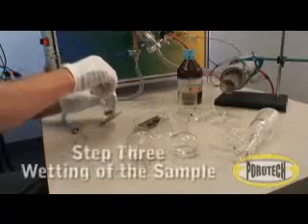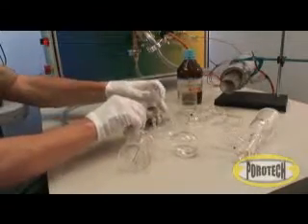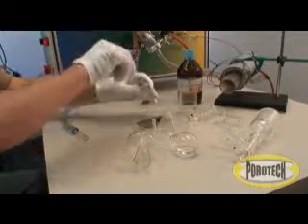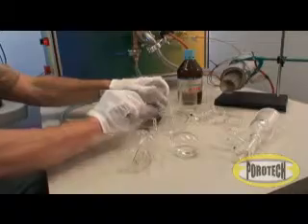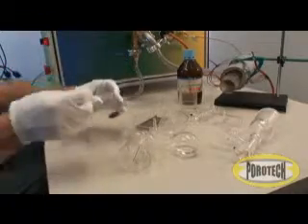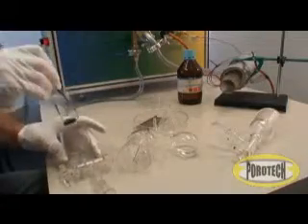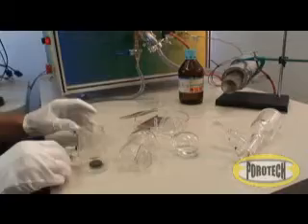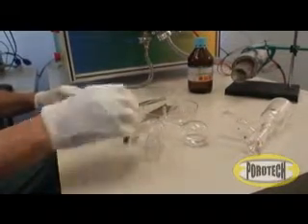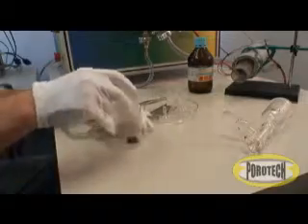Step 3. Wetting of the sample. It is vital that both the reference standards and the test sample are completely saturated with the wetting liquid. In this case, we are using octane as our measuring liquid. The test sample and the two reference standards are placed in a glass vessel and then into a saturation chamber. The pre-chamber for the octane is attached to the saturation chamber.